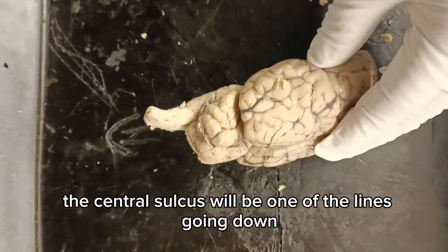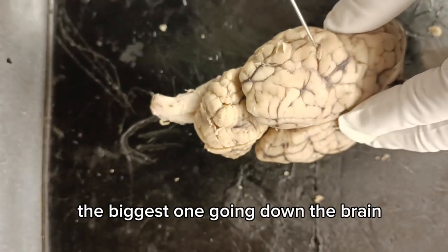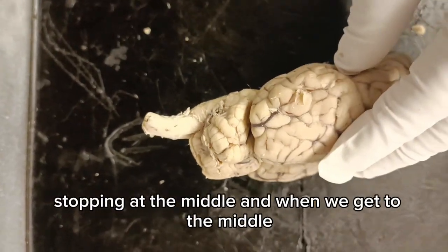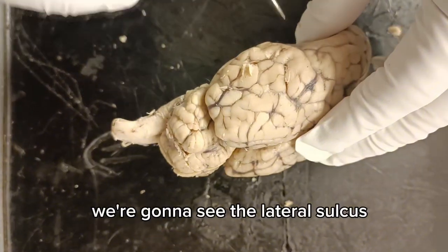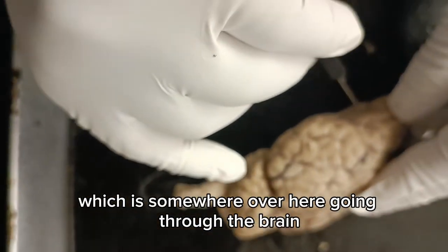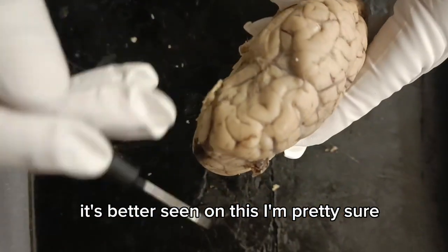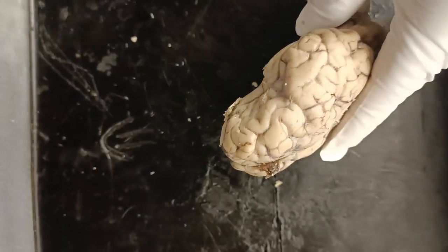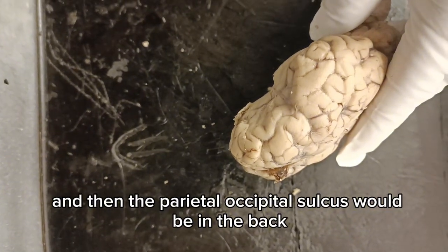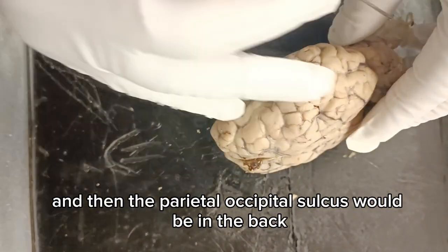The central sulcus would be one of the lines going down, the biggest one going down the brain, stopping at the middle. And when we get to the middle, we're gonna see the lateral sulcus, which is somewhere over here, going through the brain. It's better seen on this side, I'm pretty sure. And then the parieto-occipital sulcus would be in the back.